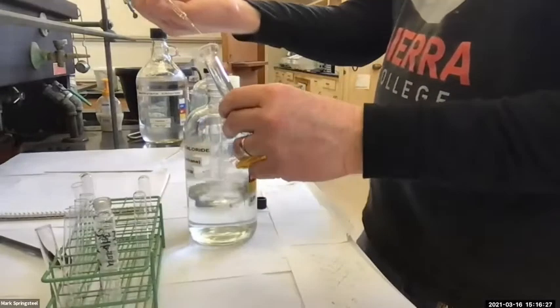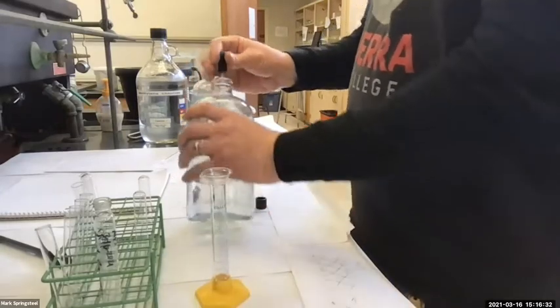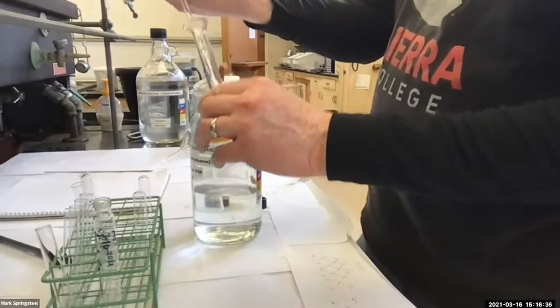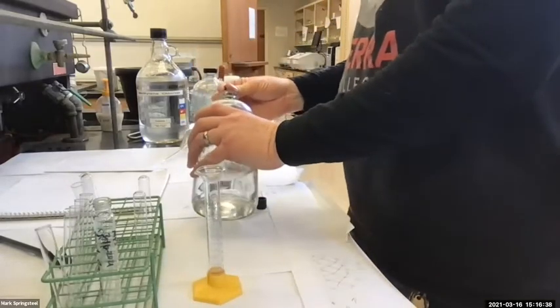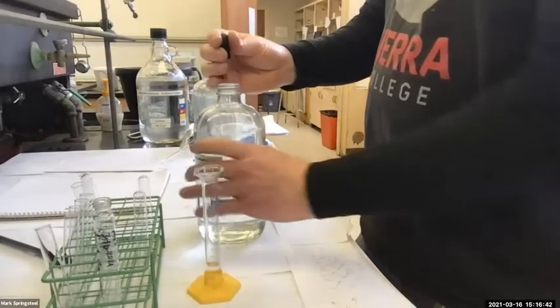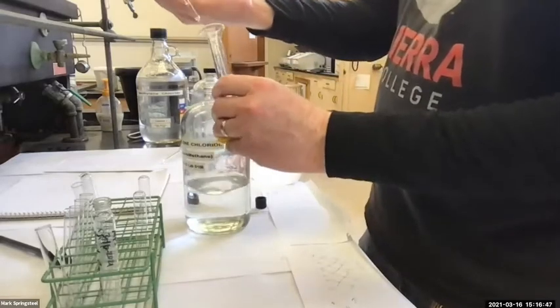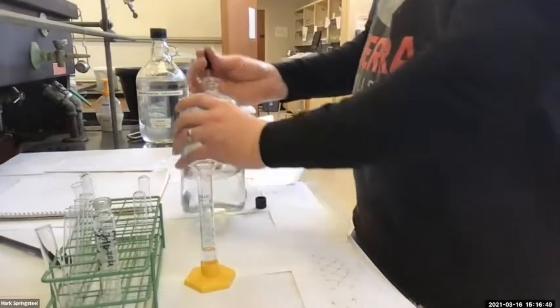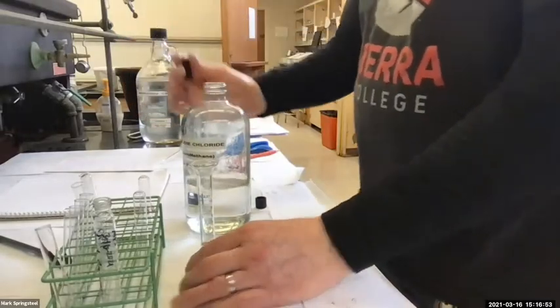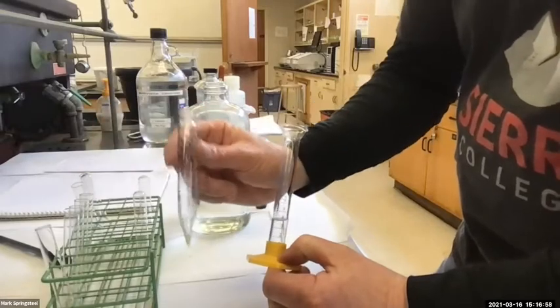Okay, back in action. I'm going to start off with about 4 milliliters of the methylene chloride, so about 4 or 5 of these pipettes full. I could use a SEP funnel to fill this, but with just 4 milliliters, I could use the short stem funnel, but I'm going to use the pipette here, almost done. And it's only approximate. Okay, I'm hoping that when I add this methylene chloride to my centrifuge tube, it'll dissolve both solids completely.